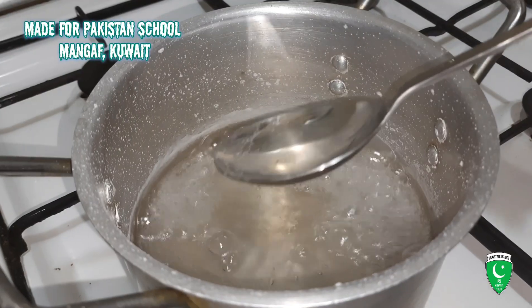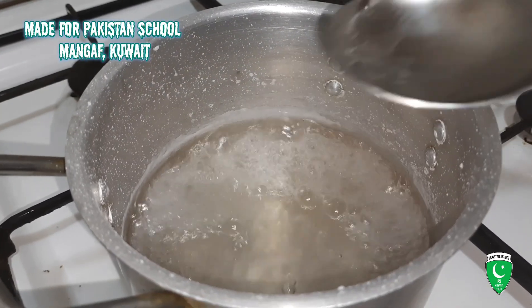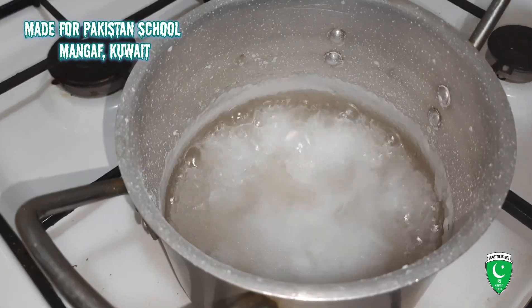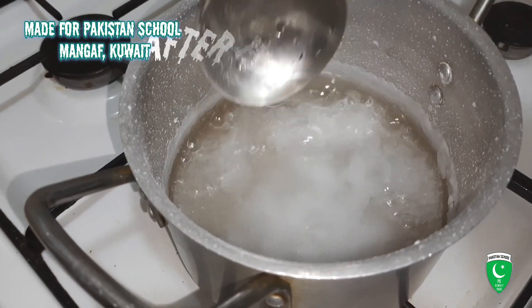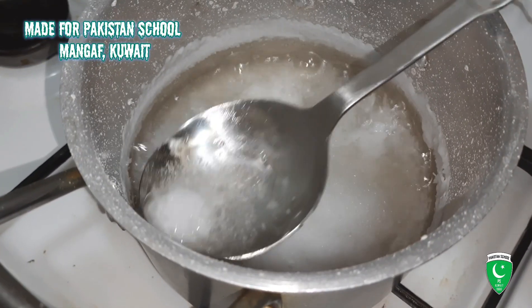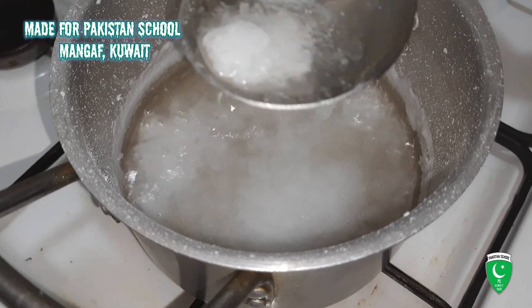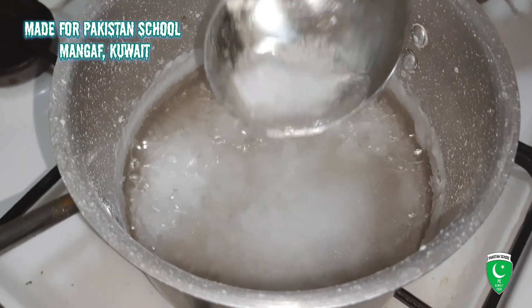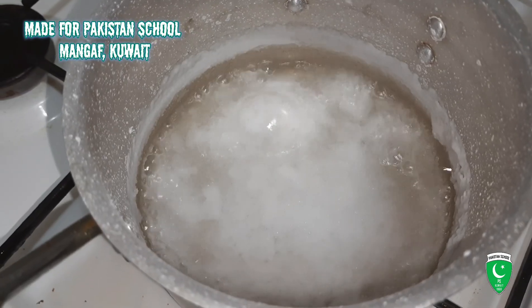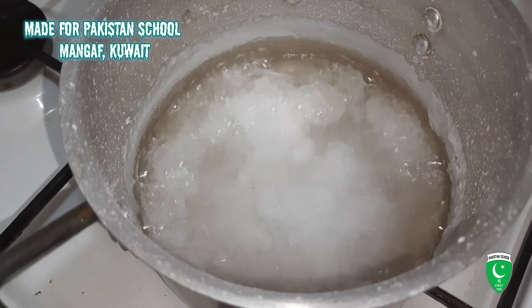Now you can see here — this is a layer of the salt. Now you can see the salt crystals. It's a crystal. We will wait until the water is vapor.